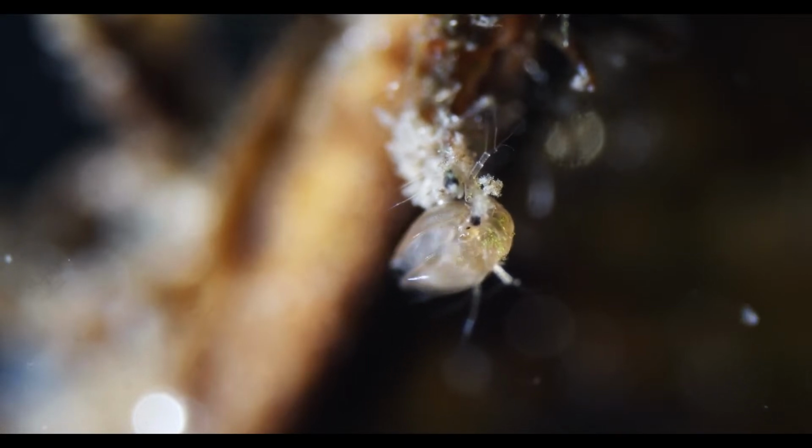So I'll do another lens change again and put in another sample. Yeah, I'll do that real quick. Should be a minute, maybe.